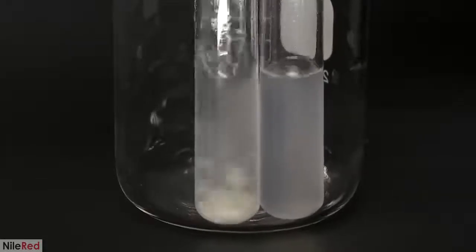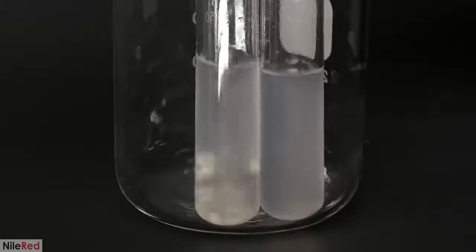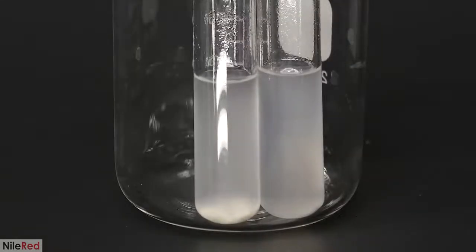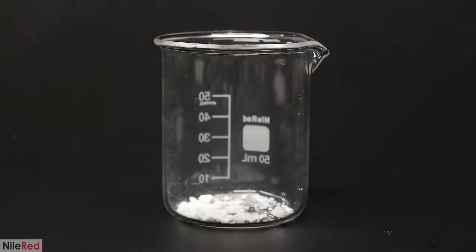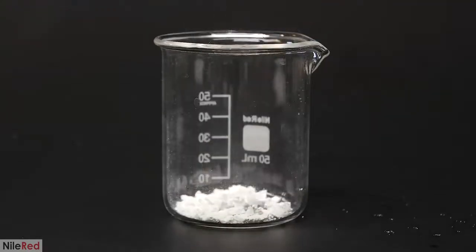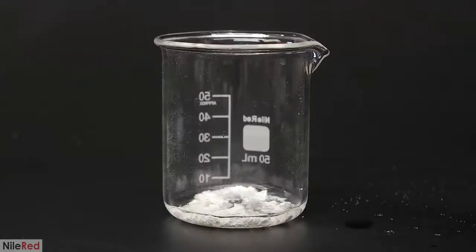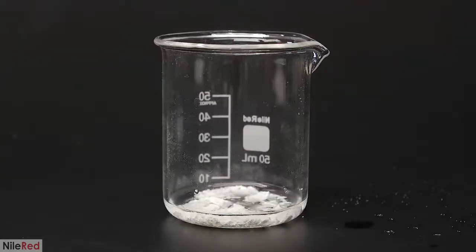Anyway, now it's time to make some plastic. I tried to find some info or detailed procedures on how to do this, but I wasn't able to find much. So most of what I'll be doing is just messing around and trying out things that I think might work. I wanted to start by making plastic films, and I first tried it out with the diacetate. I threw a random amount that I felt was enough into a beaker, and then I shot in some acetone. The quantities here aren't super important, and I'm just trying to make a really concentrated solution.